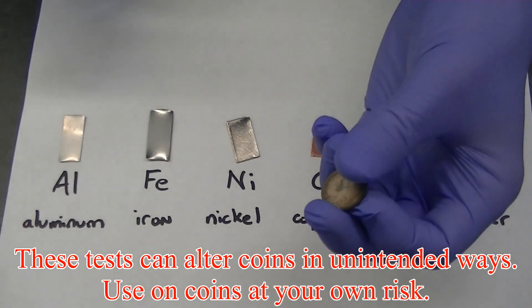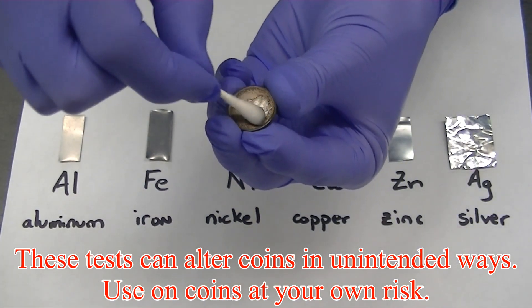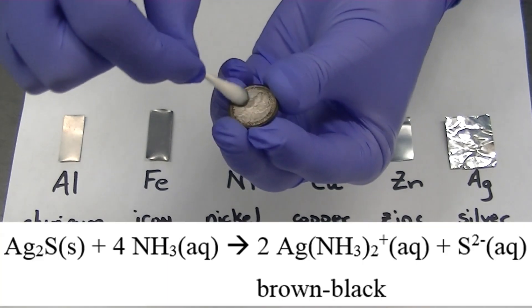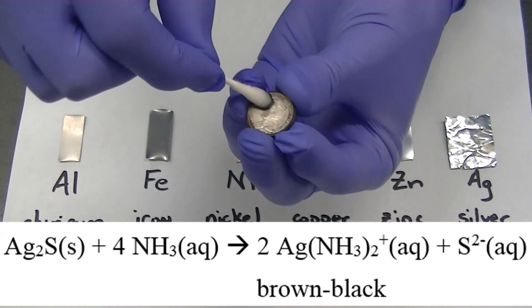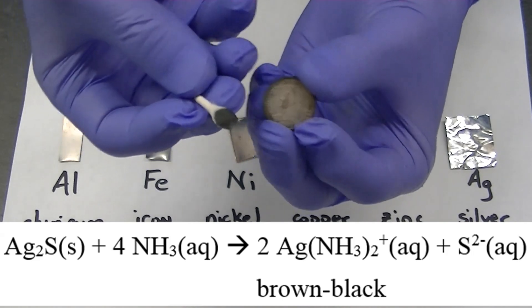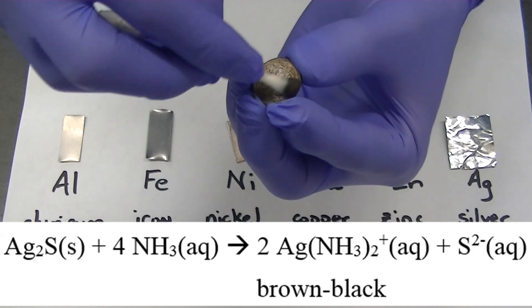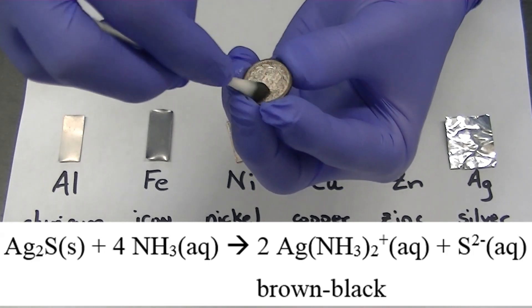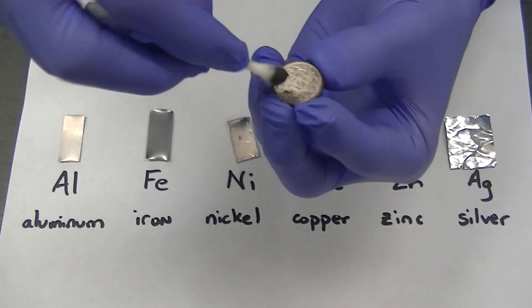Ammonia can also be used to test for the presence of silver, as long as the sample of silver has a lot of oxidized silver compounds on it, like silver sulfide. Ammonia reacts with oxidized silver compounds to form a brown-black colored complex. Thus a black color in the ammonia test indicates the presence of silver. The black silver complex dissolves in the ammonia solution.